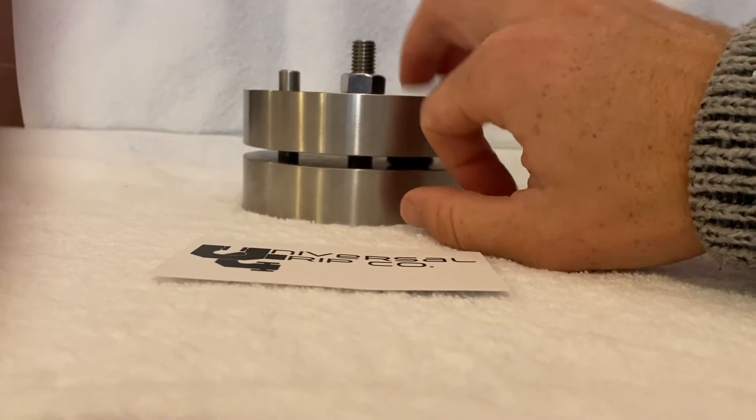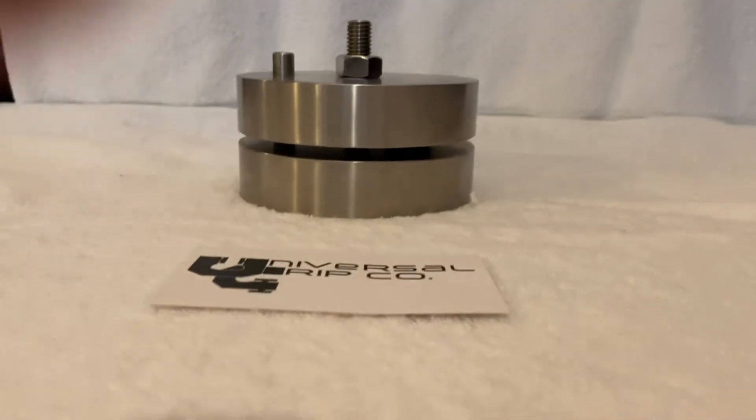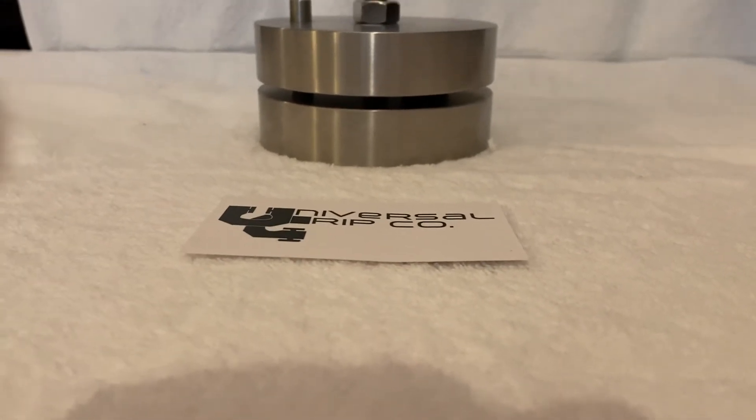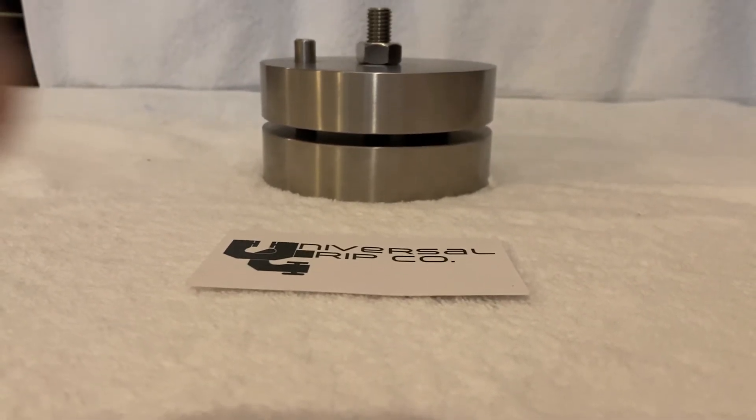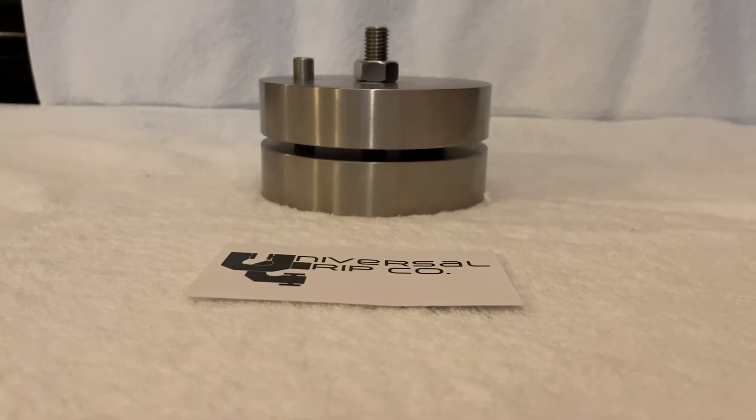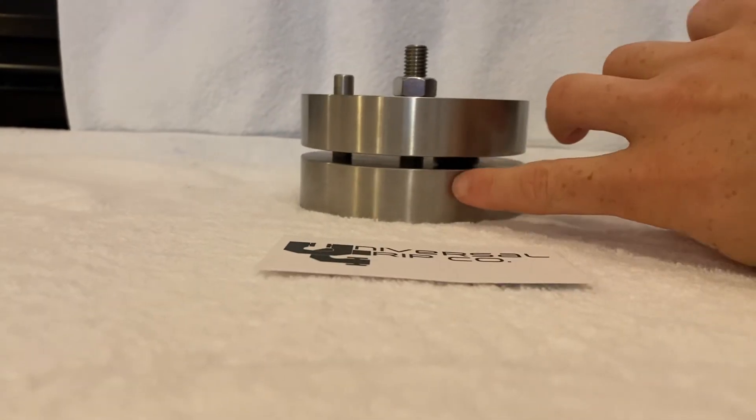Then you let the fixture sit, so it will sit for either six hours or 24 hours, however long you want to do the compression set and let it set into the sample.